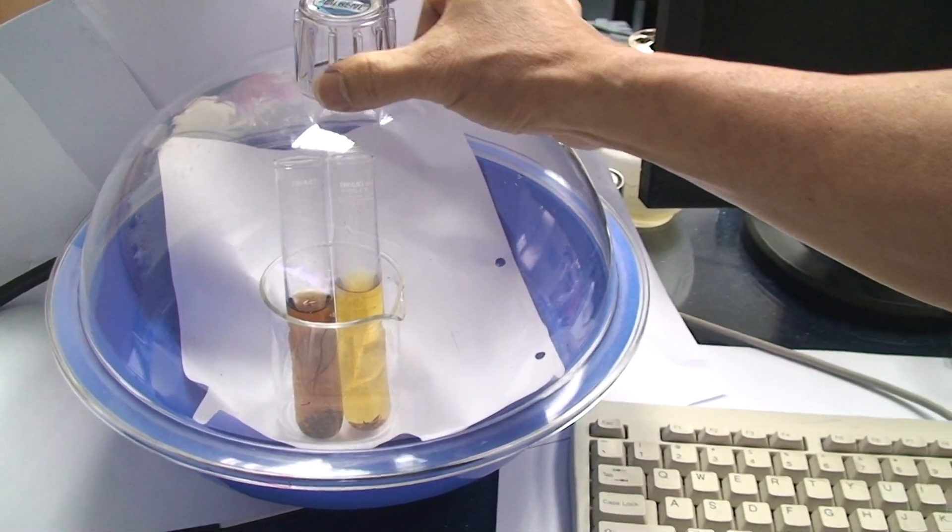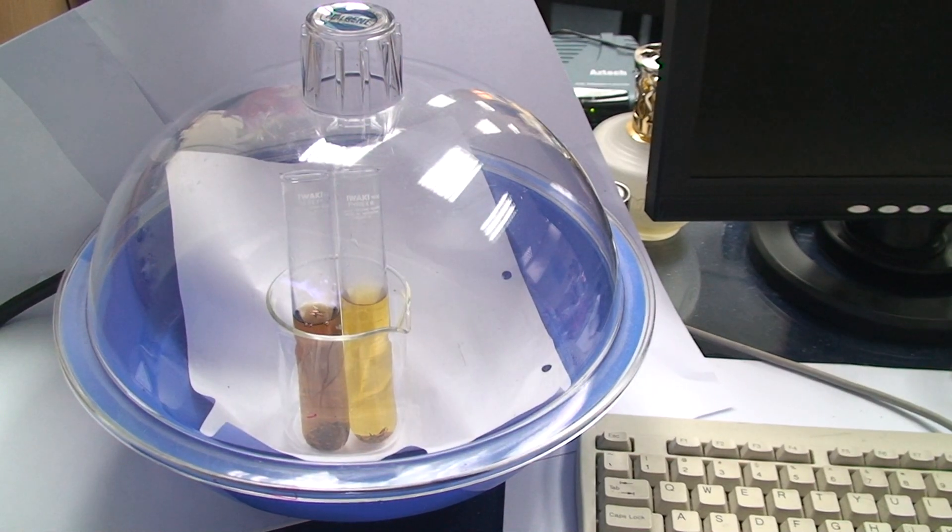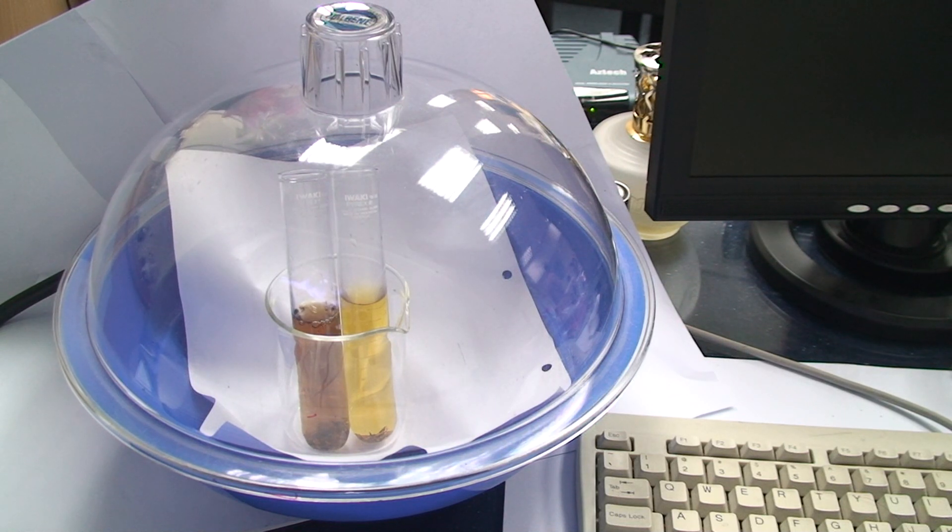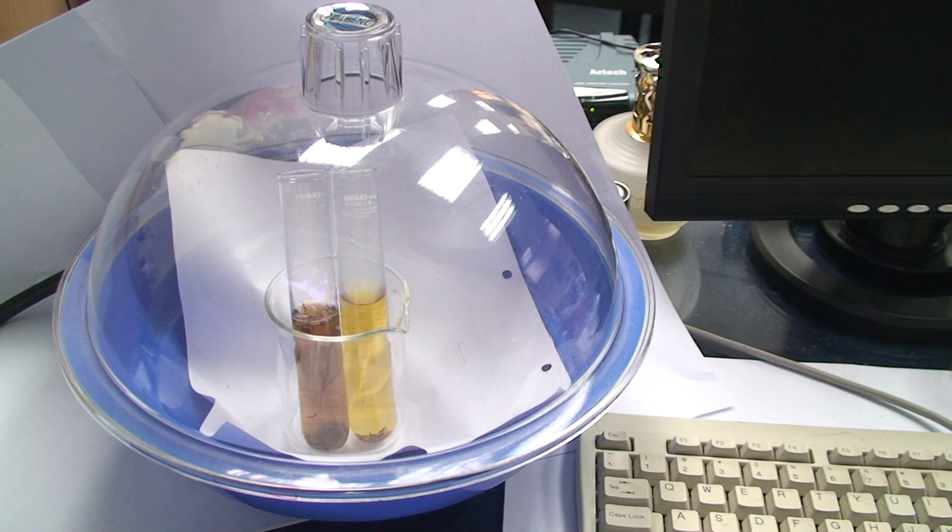So as you can see, as the air comes out from the vacuum, the vacuum chamber, there's reduced pressure and it will lower the boiling point of the liquid. It means it will start to boil at almost room temperature.